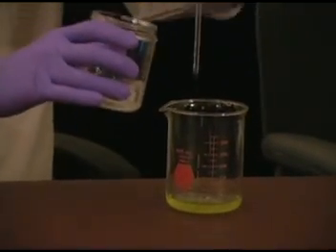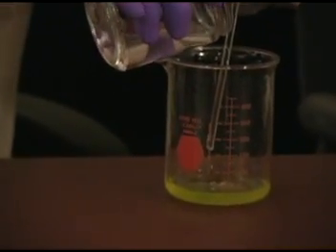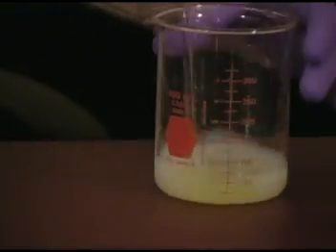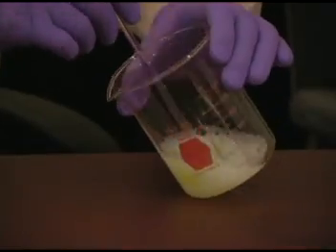Here goes some acid — pouring it onto the egg. You can see a little bit of white starting to form. I'll stir that up. So it's taking the egg white from clear to white, just as with temperature.